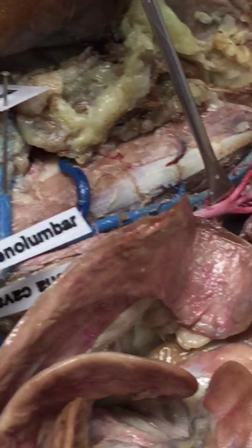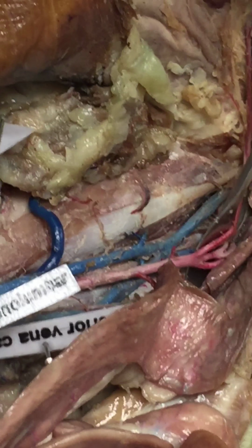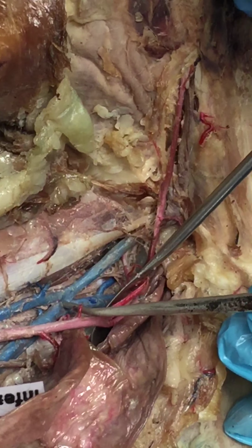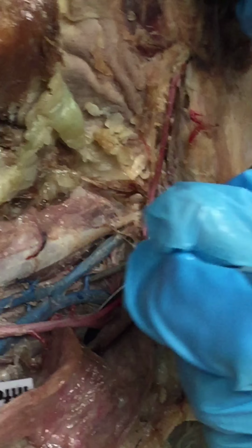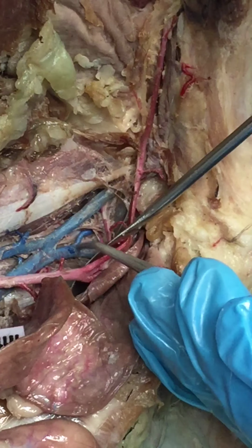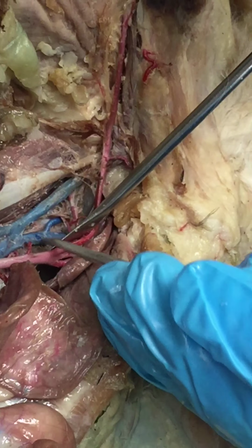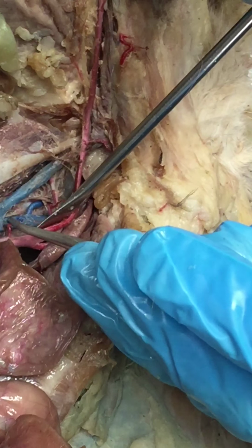Leo, you can come stand here if you want to see it better. So, you coming over? No, you're fine. Okay. So, termination of the inferior vena cava. This is your internal iliac right there. Can you guys see that? So everything above that internal iliac to the termination of the inferior vena cava would be your common iliac. In this case, it is the right common iliac.